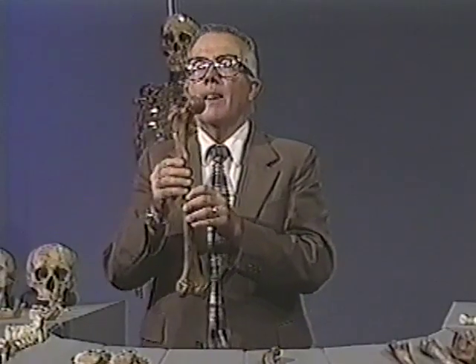Let's go back to the top end here just a minute, and you will be able to see the line of union here where the epiphysis has just recently united to the shaft. You can see a line of union right there and a line of union right there, indicating then that the epiphyses have just united.